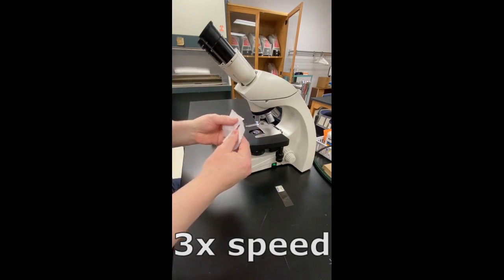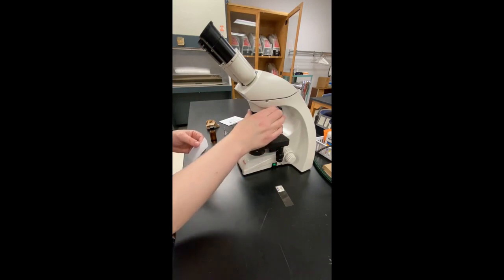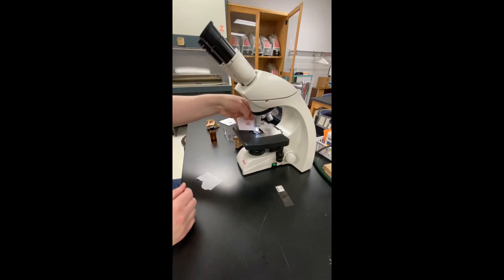Here I used a half sheet, torn in half again. If your lens is very oily, then use more. In this example, I probably could have done with one more piece. You need to apply a reasonable amount of pressure to the lens to get it clean. Keep going until there is no more oil coming off the lens.